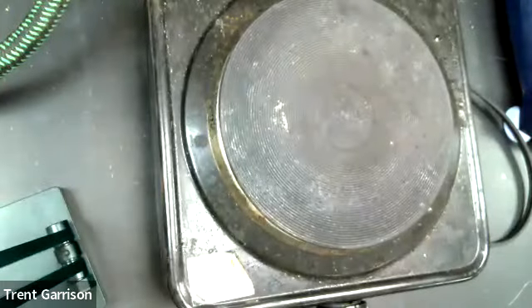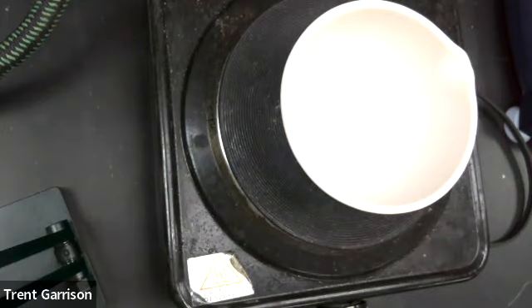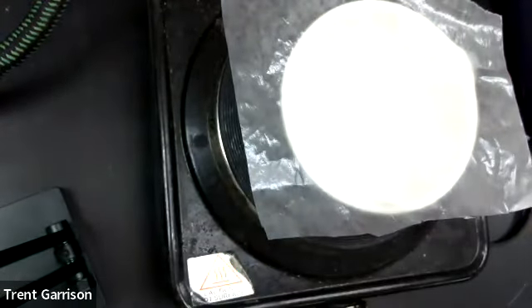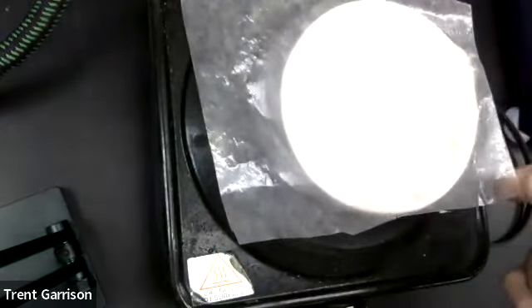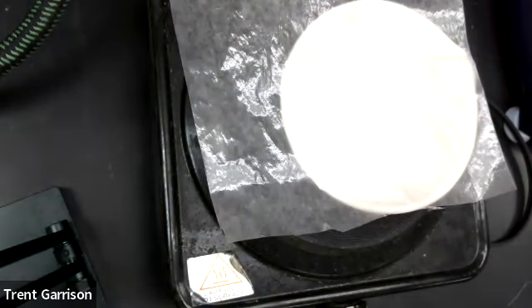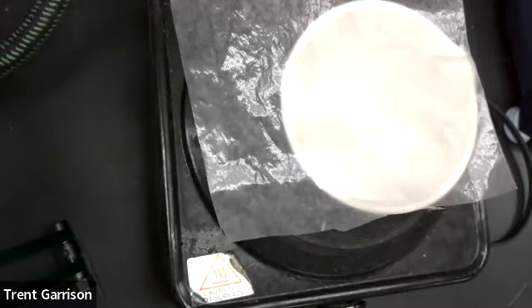And we are just going to allow this to cook. But because, again, it does boil over, I am going to put a protective barrier on it for myself and for the cooktop here so that it does not cause issues with the counter. All right. I'm going to pause and I'm going to come back and we're going to then get the weight of this final product so that we know how much we have left over. So thank you very much. Hold on. Be right back.